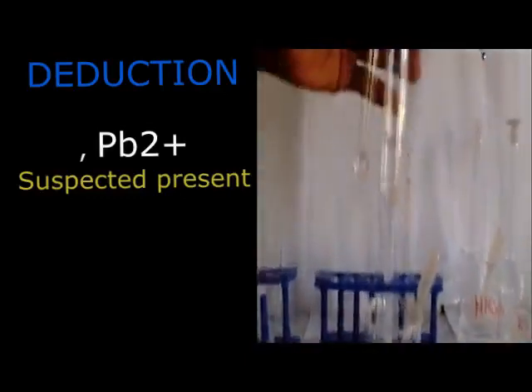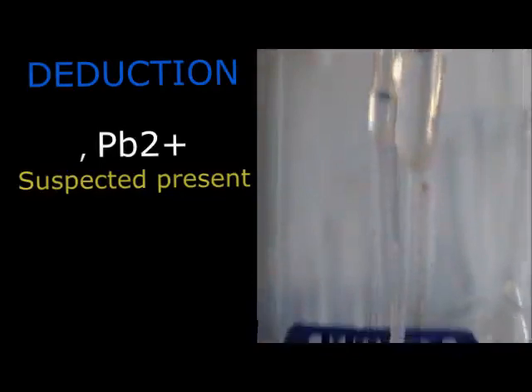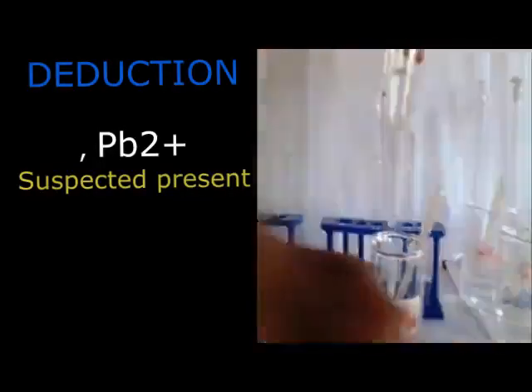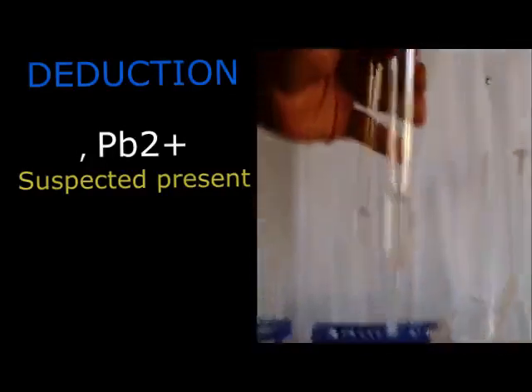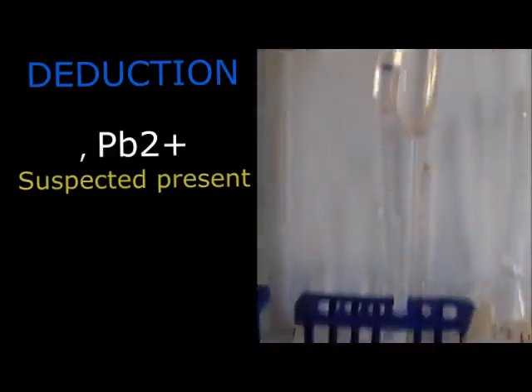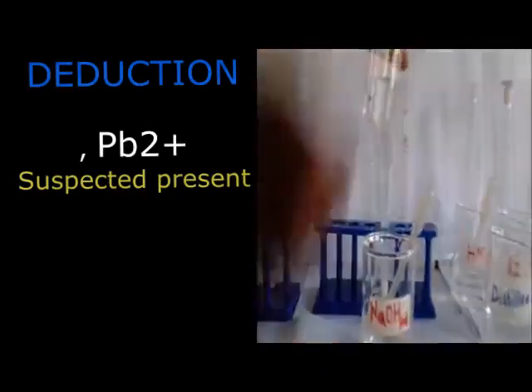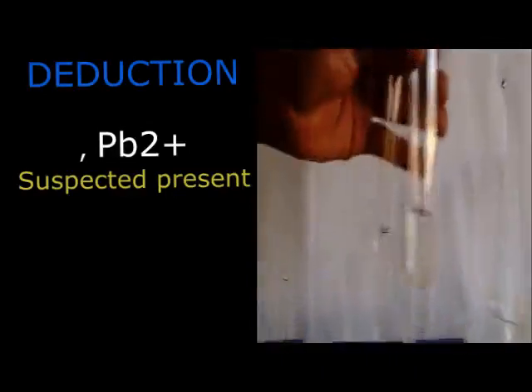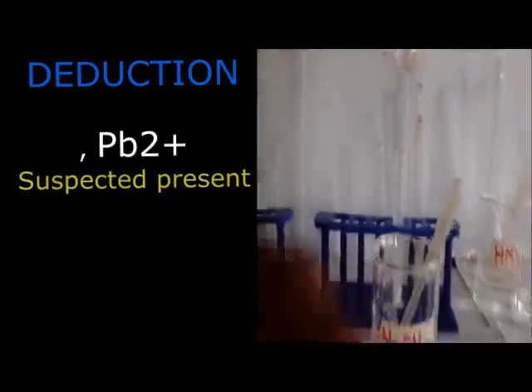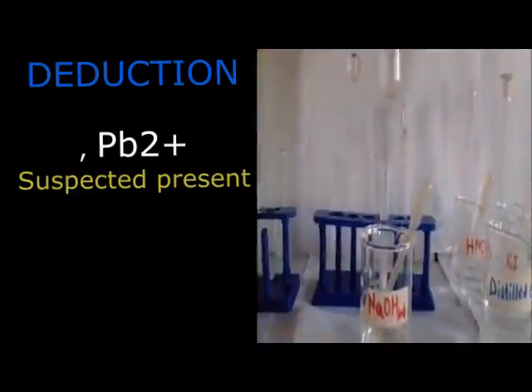Then we continue with our tests. Remember we have said white precipitate soluble in excess sodium hydroxide to form a colorless solution. Now the second test is saying to the second portion add excess aqueous ammonia. Now members, before you add even ammonia, you can see that the solution formed by adding sodium hydroxide after the dissolving of the precipitate resembles the other one where we have just added the water.